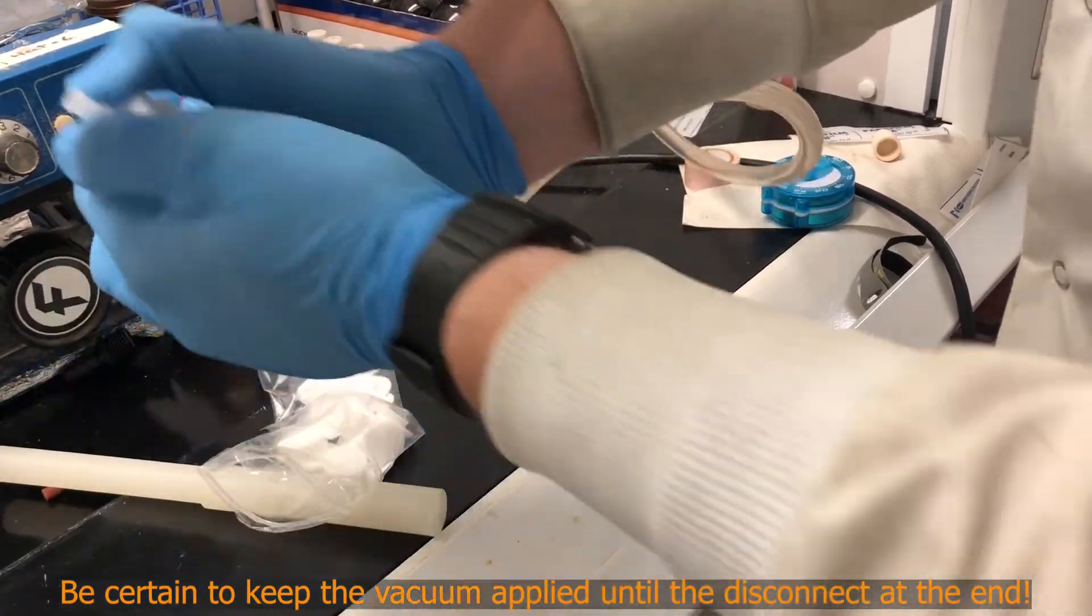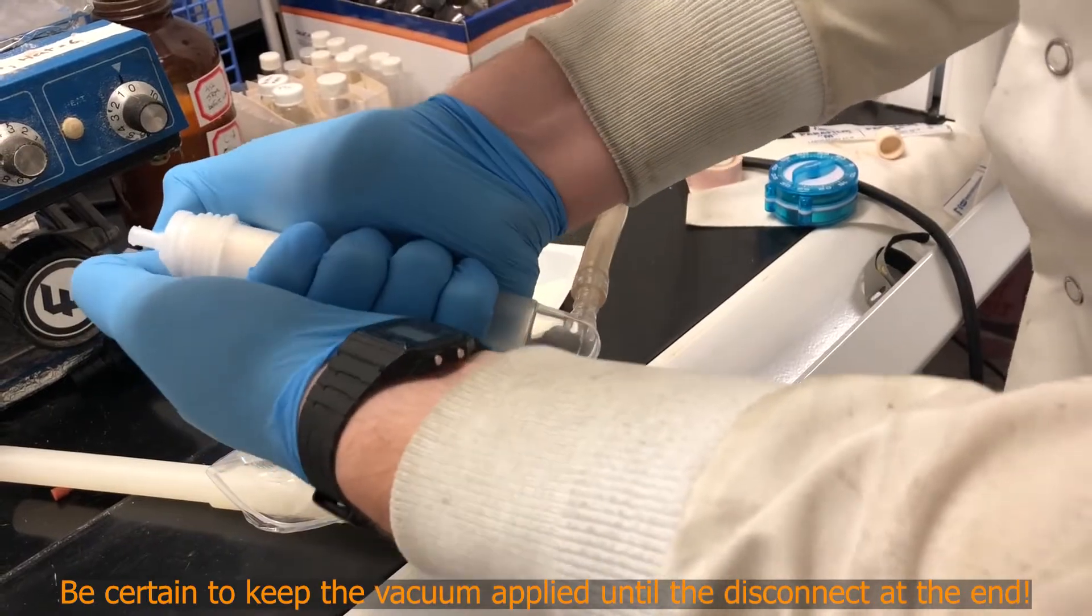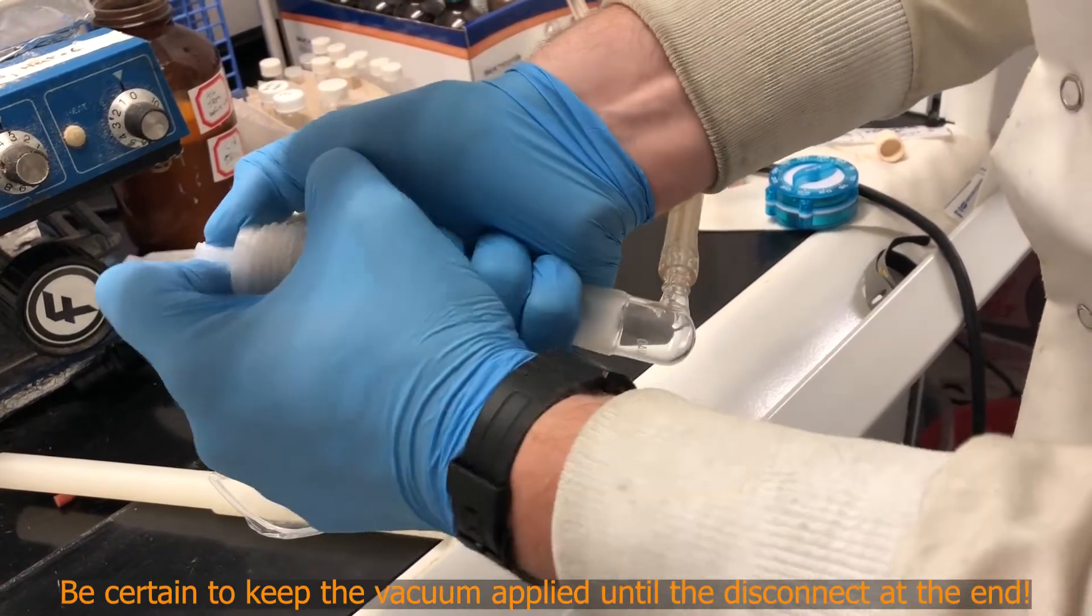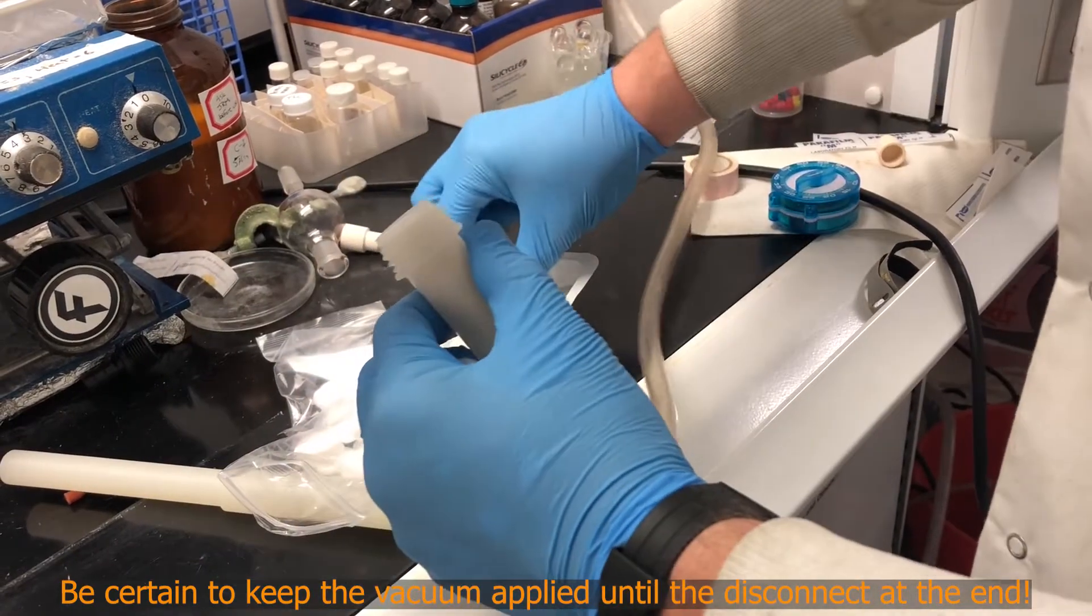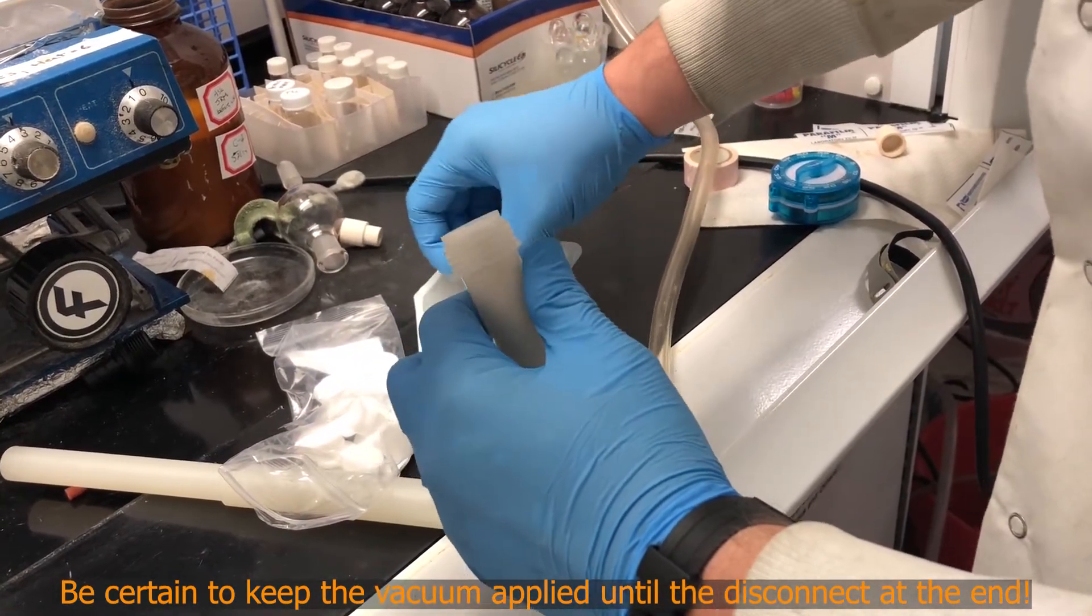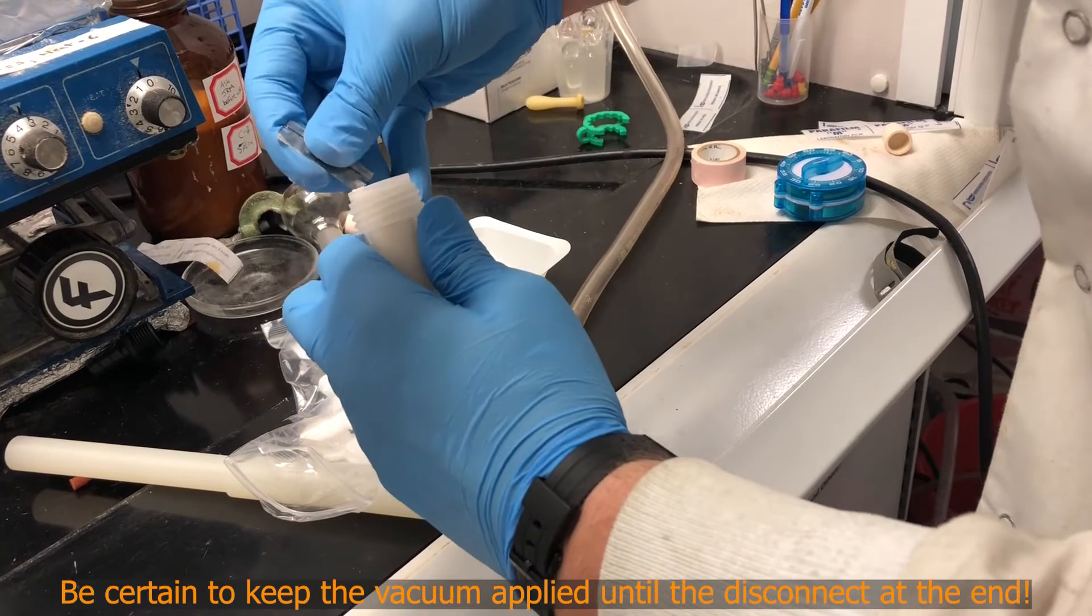Take your top piece here. You want to make sure that this can actually clip on. You should hear it snap on when you're trying to do this. It's not, which means there's still too much silica in there. I'm going to pull this frit back out.